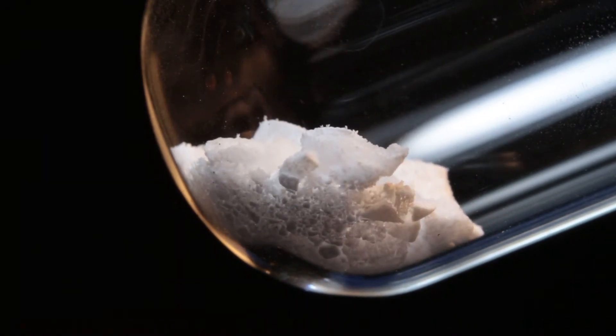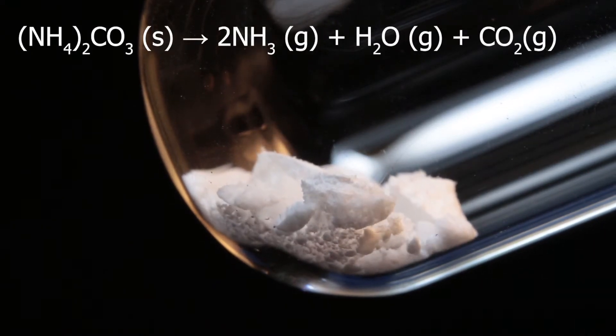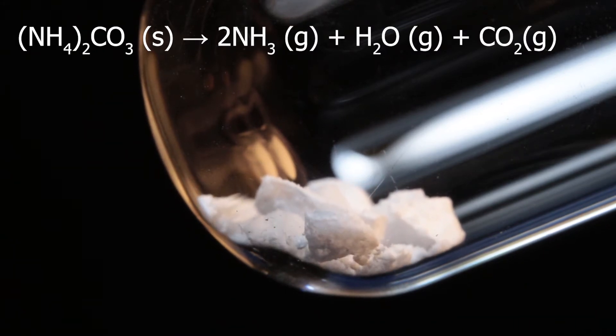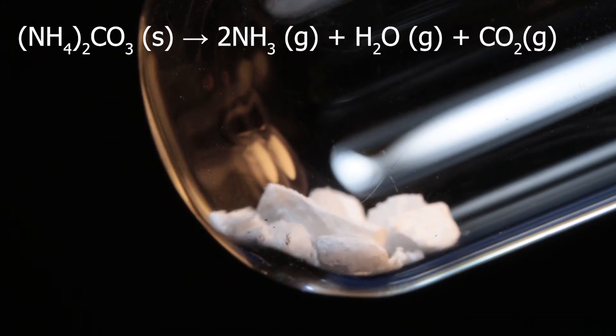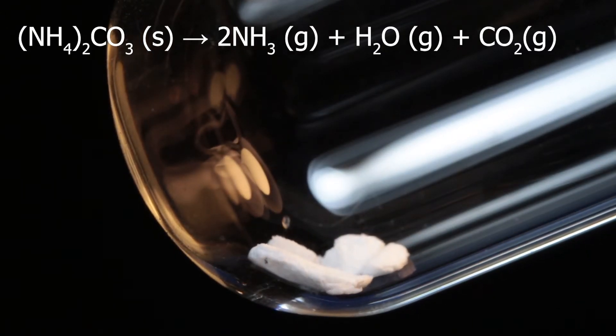As if it melts, but there is no liquid. In fact, it decomposes into three gases: ammonia, water which is gas at this temperature, and carbon dioxide. All three are colorless. As if our ammonium carbonate disappears into nothing.